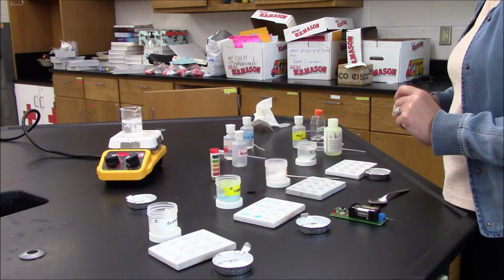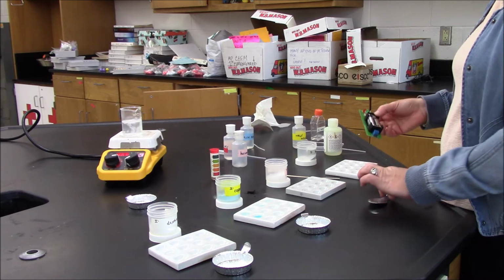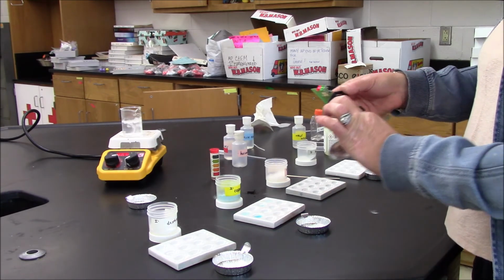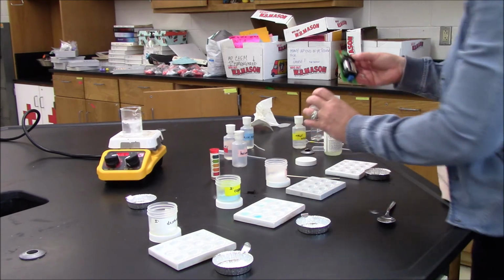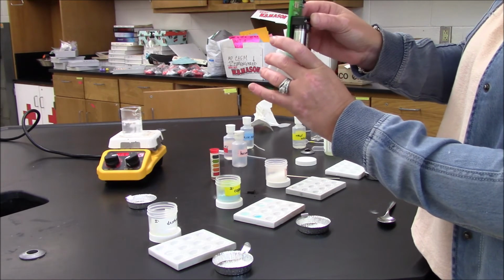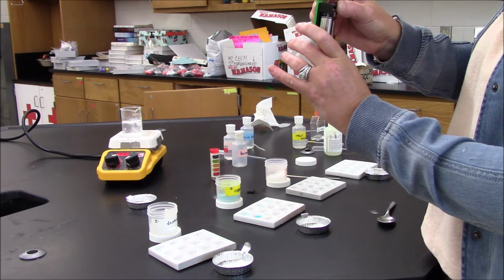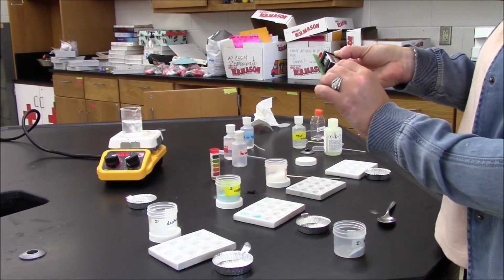The last substance that I'm going to test is zinc, a metal. I'm going to check my conductivity meter to make sure that it's on. Check the conductivity of the solid, if there's enough in here. And I have to find a piece that's big enough that both of these electrodes will hit it.